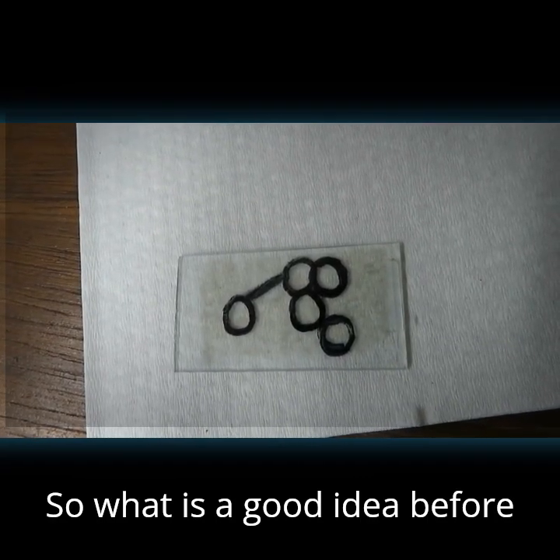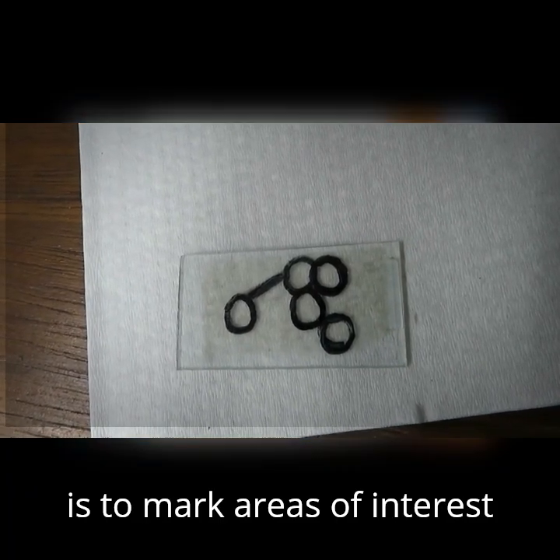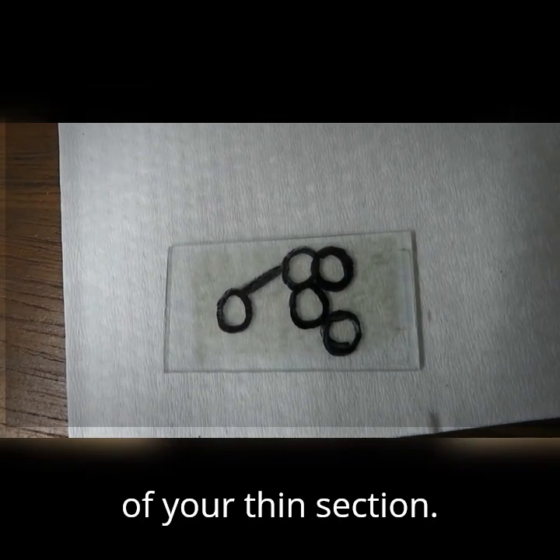So what is a good idea before you start doing SEM analysis is to mark areas of interest with a permanent marker on the rock side of your thin section.